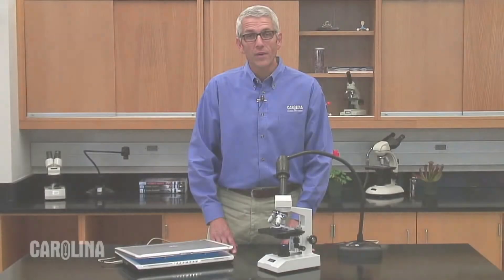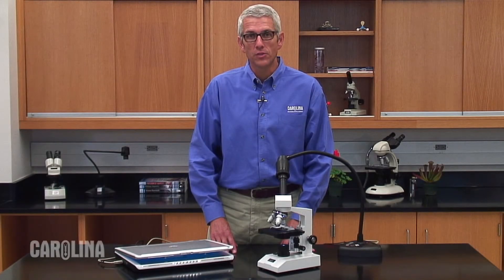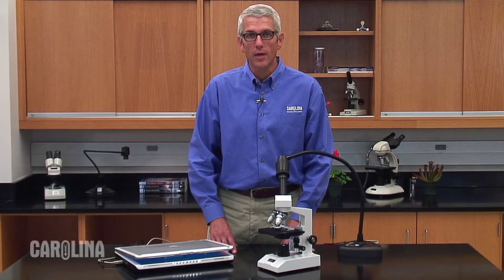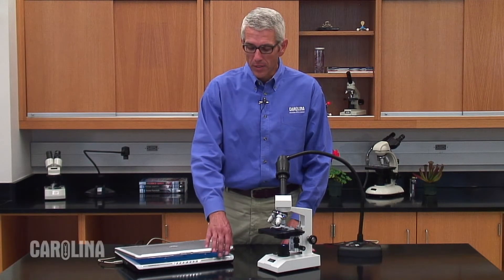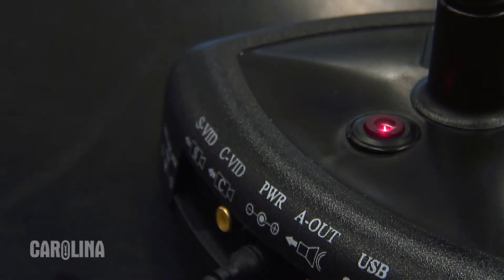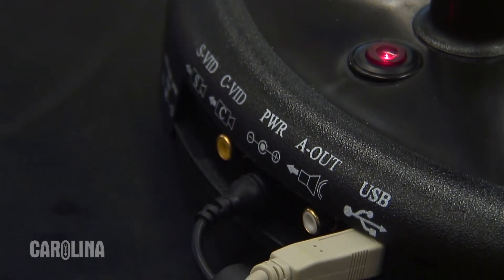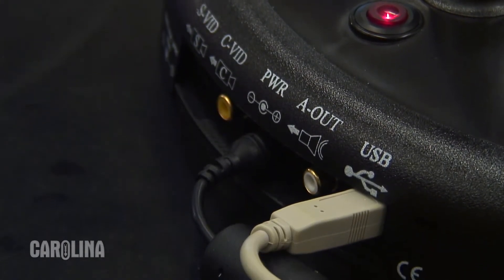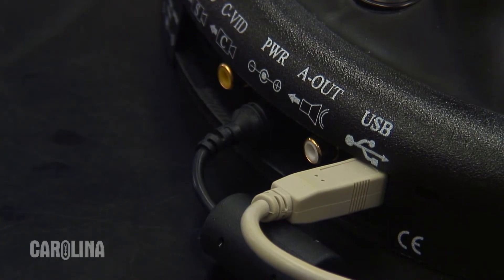The VideoFlex 7600 has all the features of the StudentCam and the TeachCam but adds the ability to capture images and save them directly to your computer. This camera has the same video and audio outputs of the other cameras but it also has a USB 2.0 output.